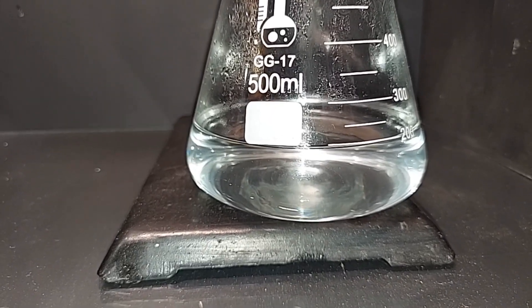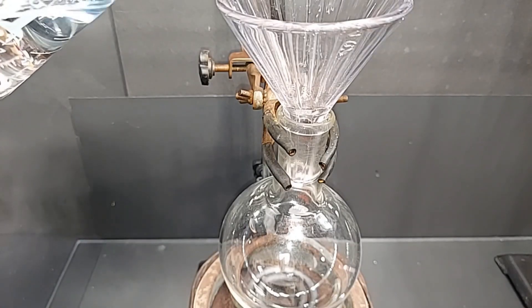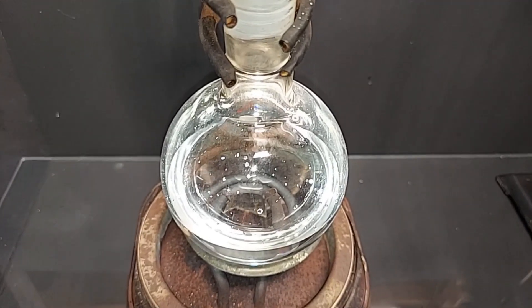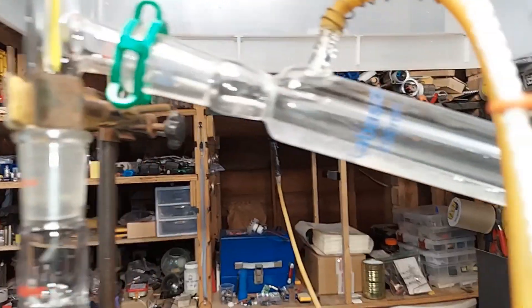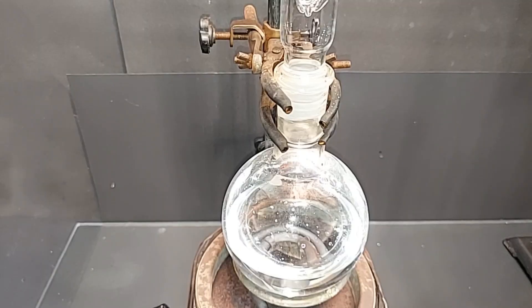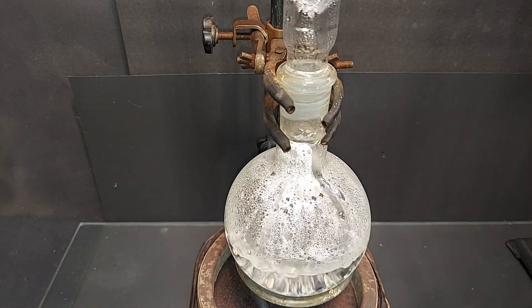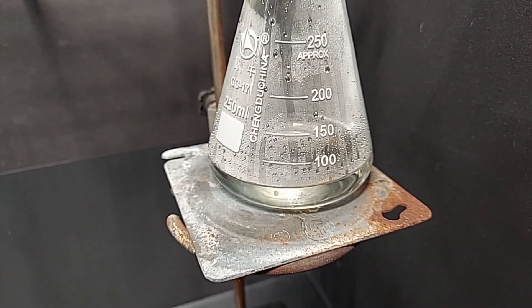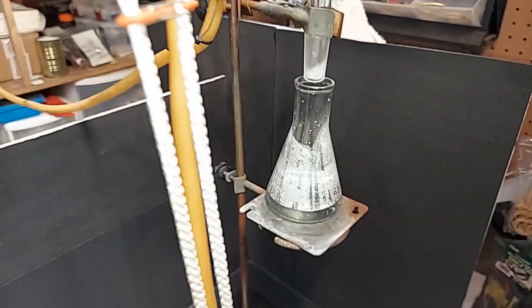Transferring the formic acid and water solution into a new 500 milliliter round-bottom flask in preparation for fractional distillation. The setup has a fractional distillation column going up to the distillation head with the thermometer, then across the cooling tube and into a collection flask. The solution has come to a nice boil. I covered the column with aluminum foil to help heat it a bit. We're holding at exactly 100 degrees Celsius and on the collection end we've collected about 50 milliliters. Within the next 50 milliliters we'll be swapping out for a new flask. We just jumped to 101 degrees Celsius — that's our cue to swap out the flask.